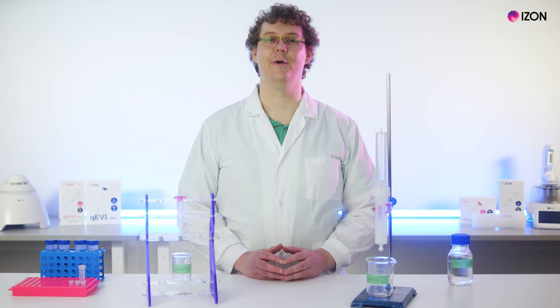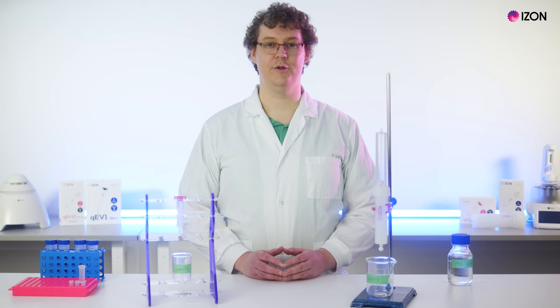The sample collection vessels can be one tube if you are interested in a pooled sample, or multiple tubes if you are interested in collecting an individually fractionated sample.